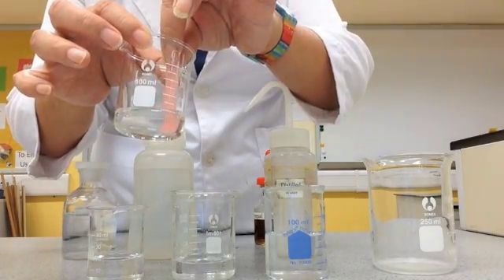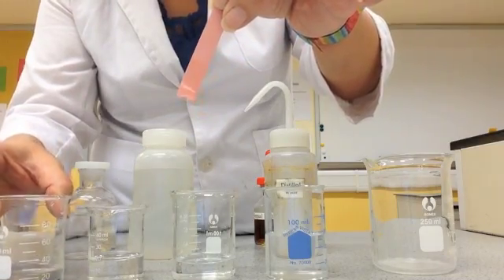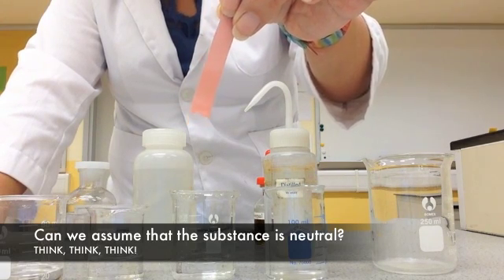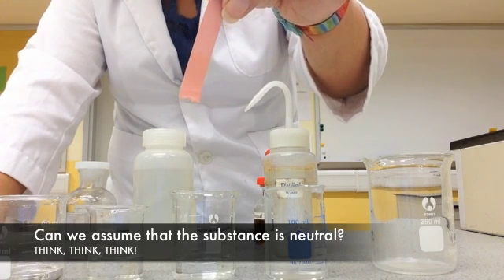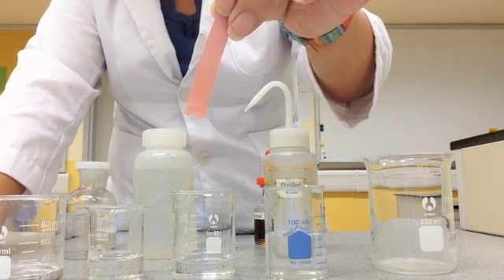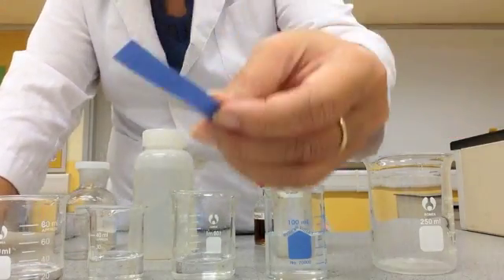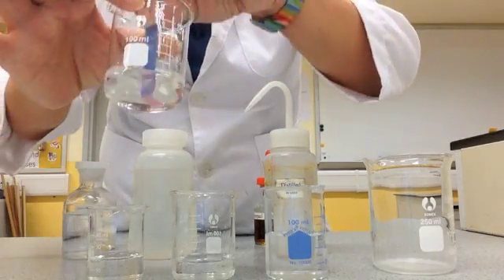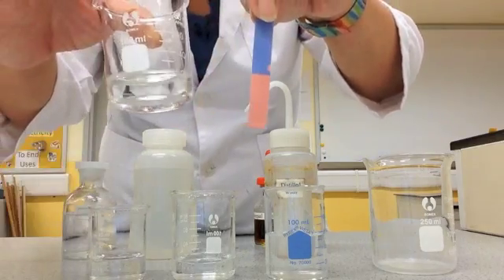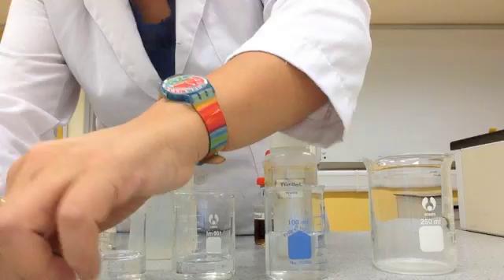Let's start with the first substance. The red litmus paper remained red — so can we assume it's neutral because it didn't change color? No — I need to test with the blue litmus paper. The blue became red, so this is an acid. If you said acid, you're right.